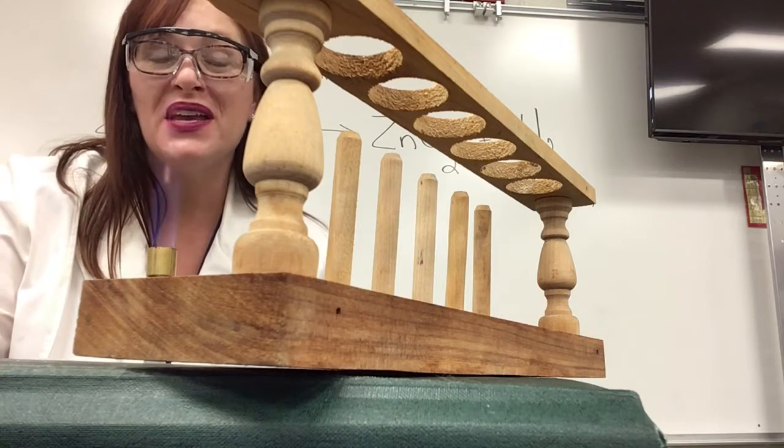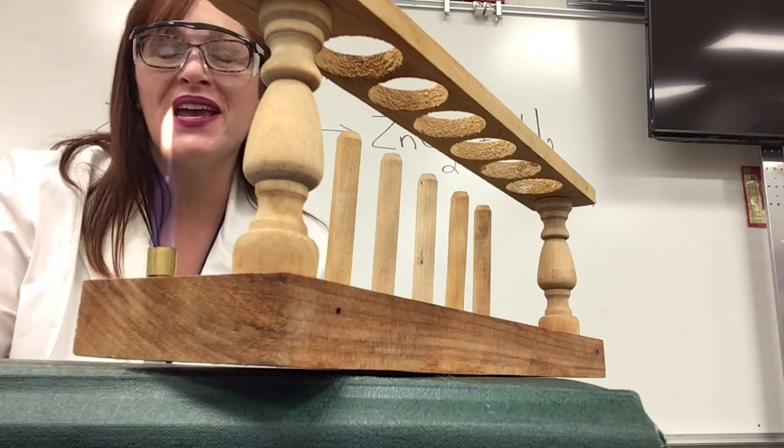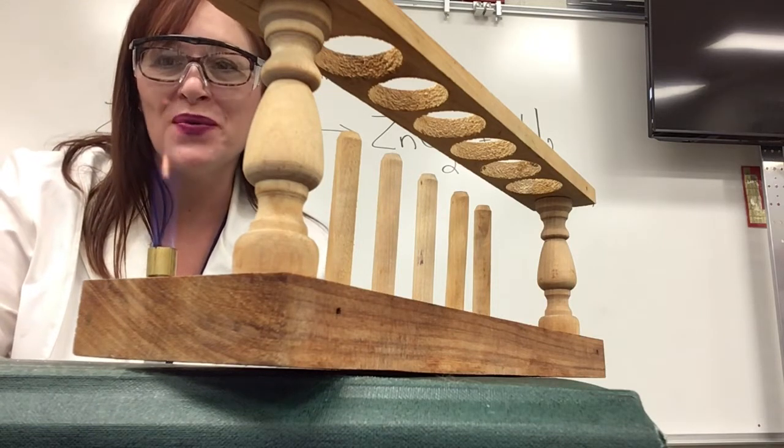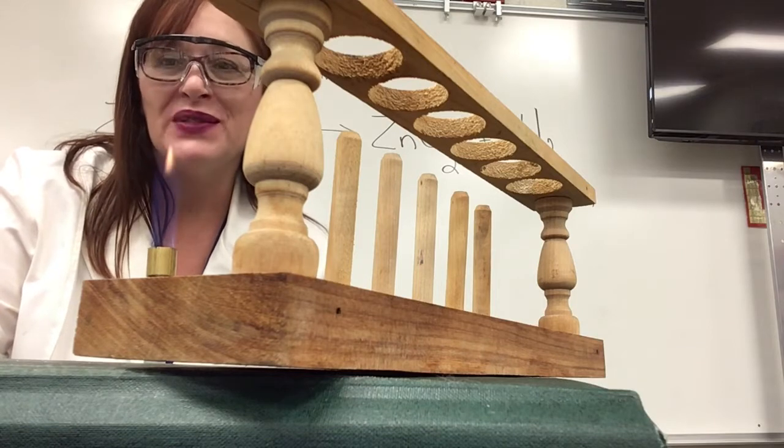Hi, Ms. Venable here bringing you another chemical reaction. This time we are doing a single replacement reaction using zinc.